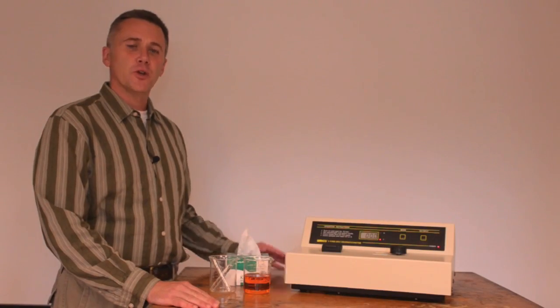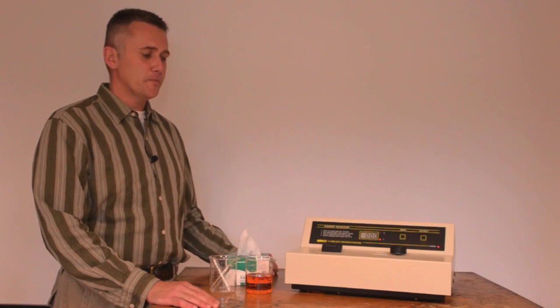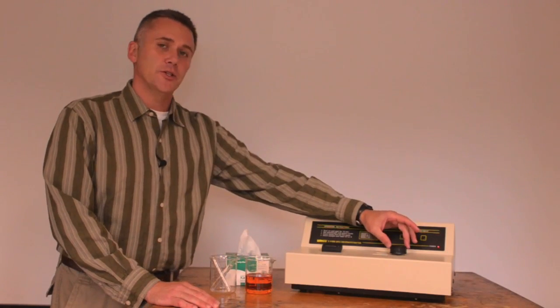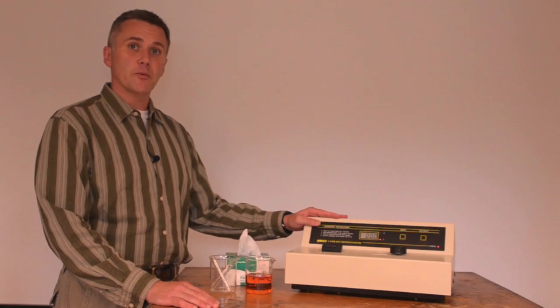We'll use the spectrophotometer to measure the absorbance of our solution. In order to use the spectrophotometer, we'll want it warmed up for 15 minutes. There's a switch on the back to turn it on, but typically your lab instructor or lab TA will have it warmed up for you. After the warm-up period, you can set the wavelength with this dial. In our experiment, it's 455 nanometers.